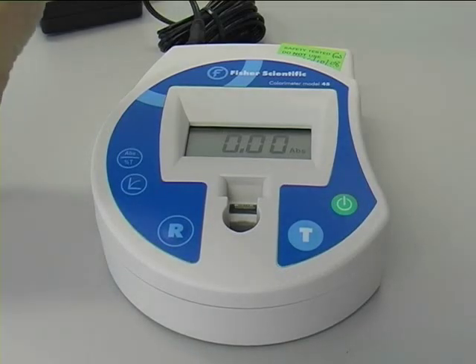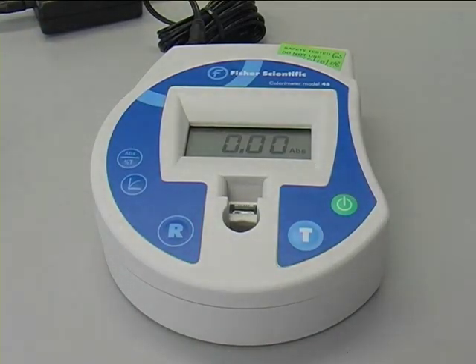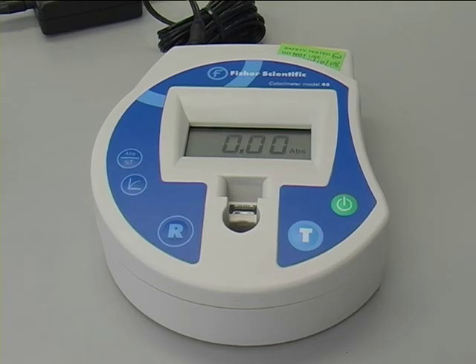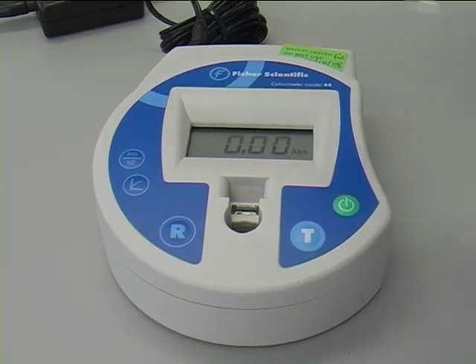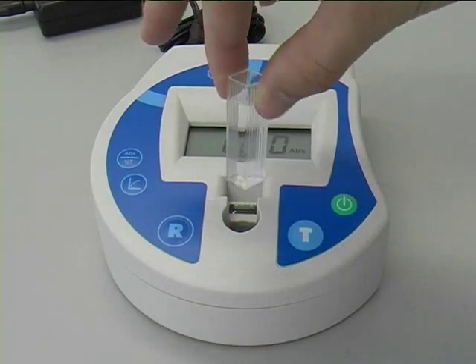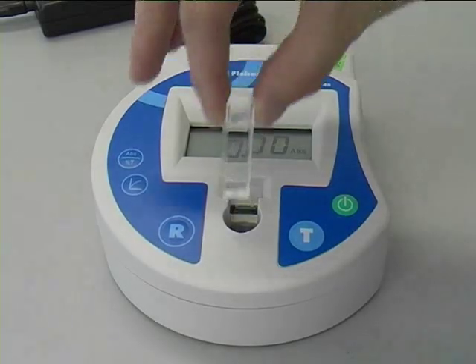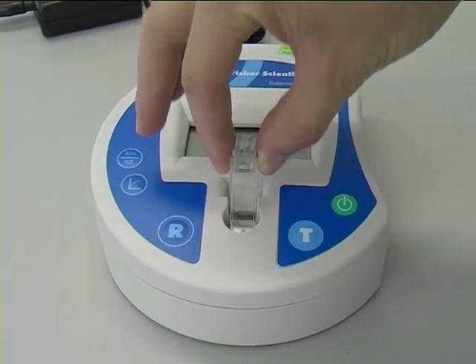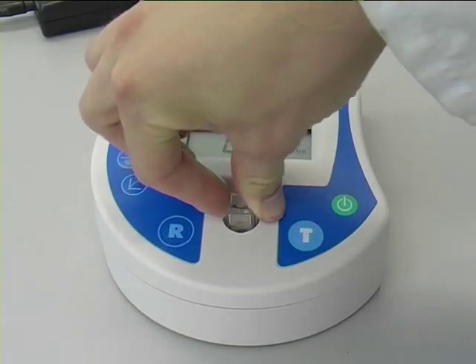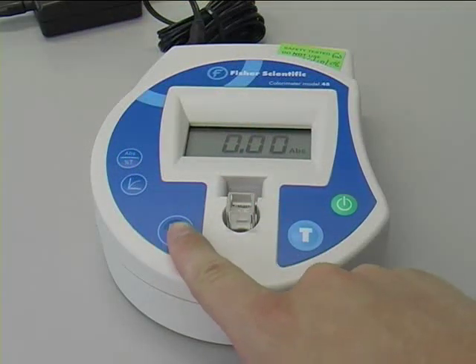Referencing the colourimeter is usually done using water as the reference. Insert the reference cuvette in the colourimeter and press the R button. The display will come up with an absorbance reading of zero.